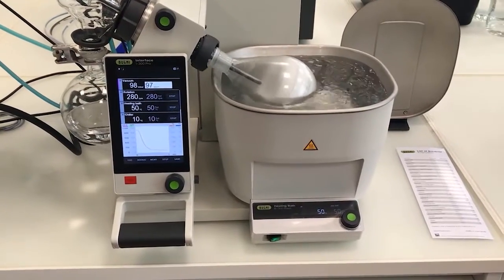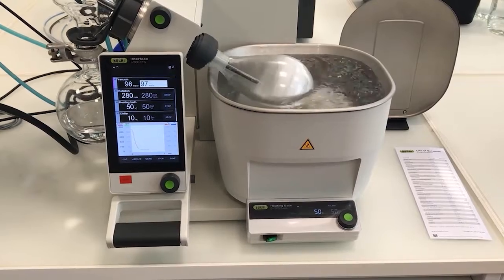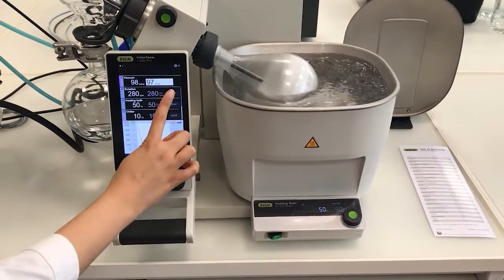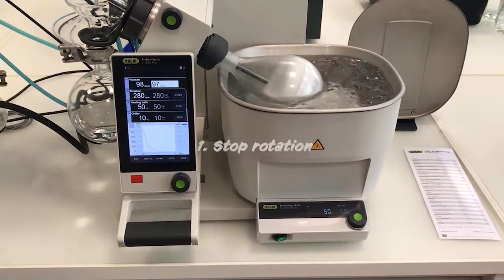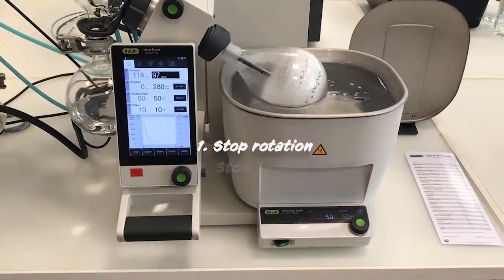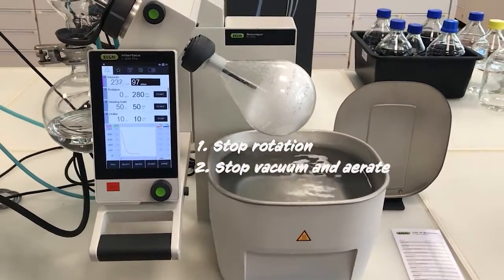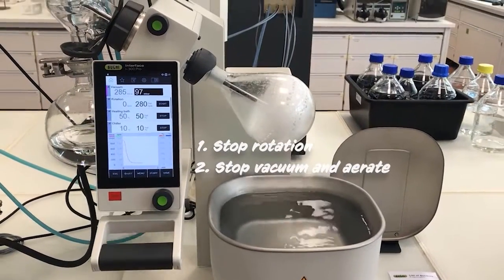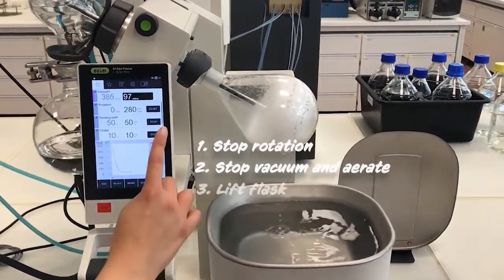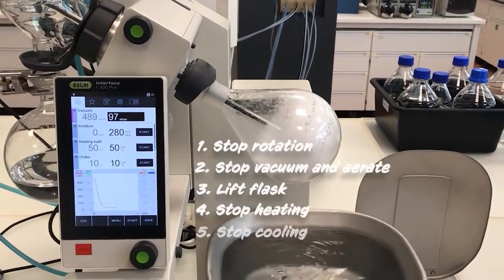Now that our evaporation is over, we need to stop the system. We firstly stop the rotation speed, then the vacuum, and aerate the system until it reaches atmospheric pressure. We then lift up the flask and stop the heating and the cooling.